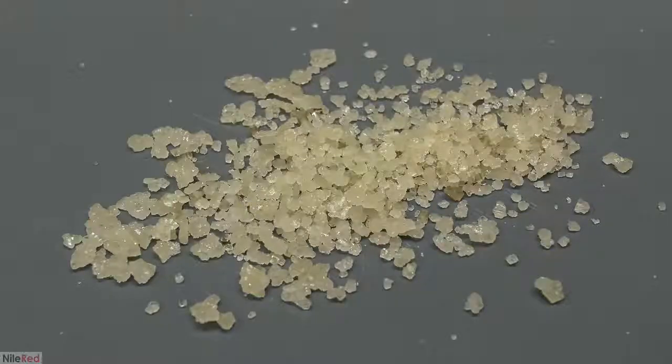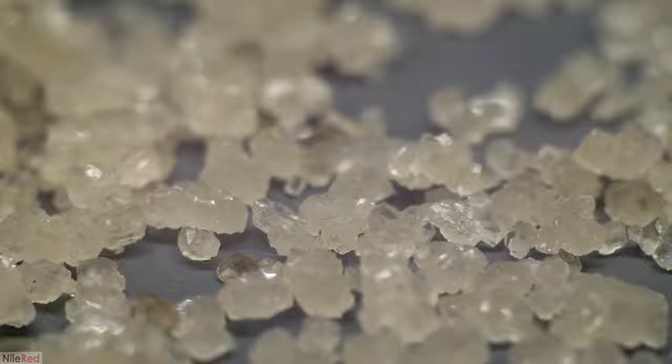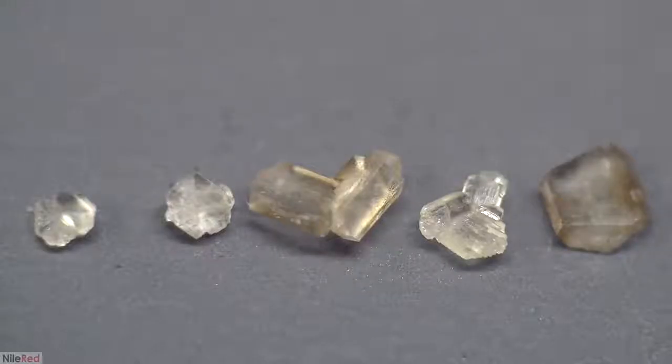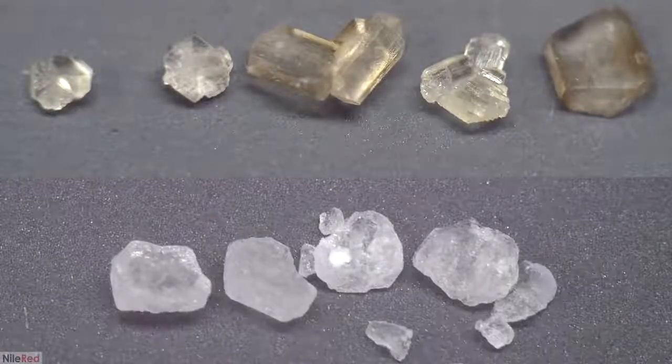Just for fun now, I'm going to take a closer look at the crystals. Using a crappy and cheap lens that I got a few years ago, I was able to get some decent shots. These are 5 crystals that I picked out and lined up, and you can see that their structures are quite different. I've also gone ahead and taken a shot of pure citric acid.